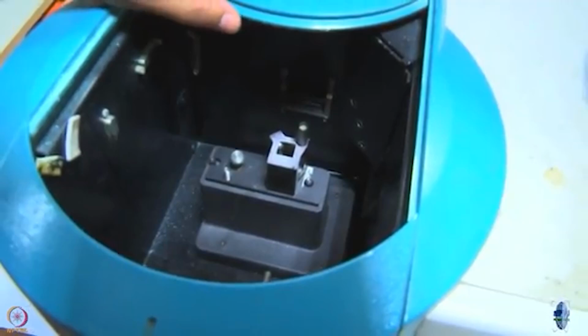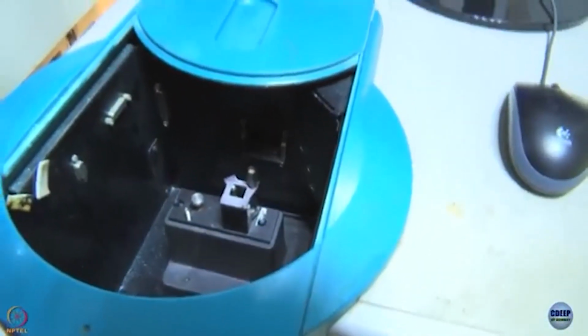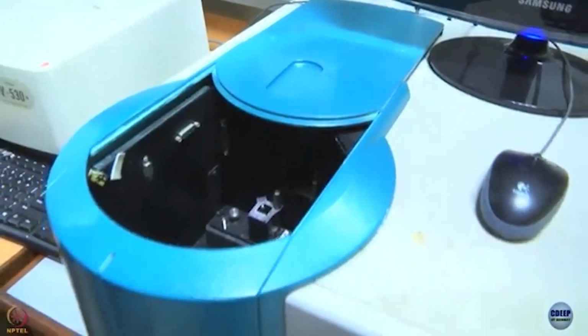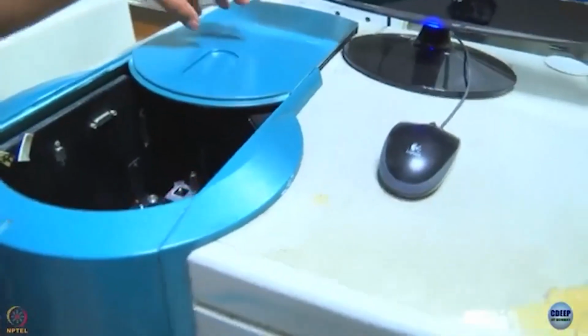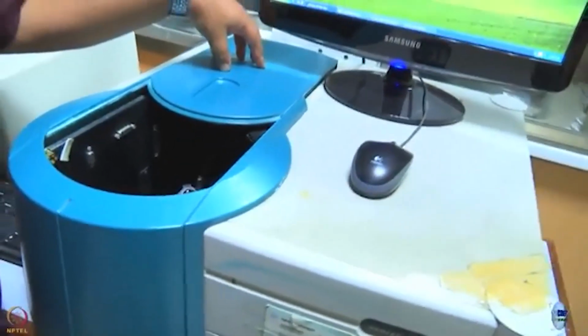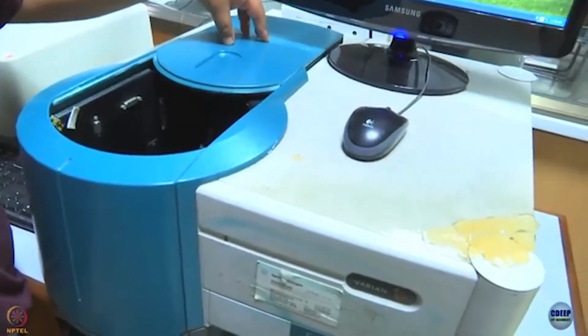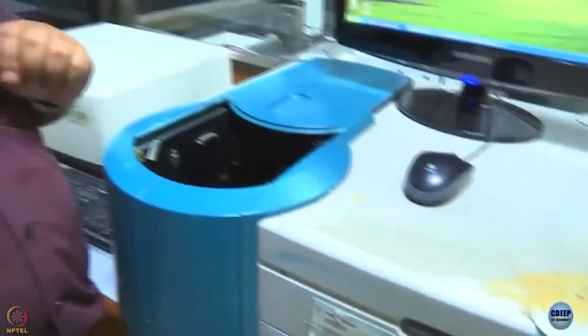And do not forget, we have two monochromators here, an excitation monochromator on this side and an emission monochromator on this side. To start with, we are going to keep our sample in here, keep the excitation monochromator at a particular position and vary the emission monochromator. That way, we are going to record an emission spectrum. Later on, we will do just the opposite and record an excitation spectrum.